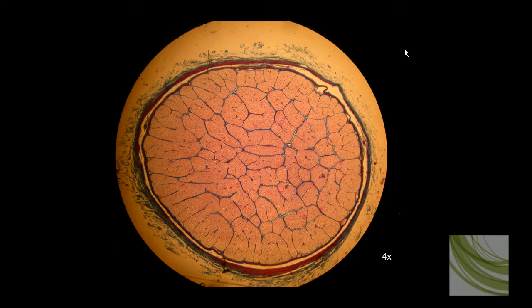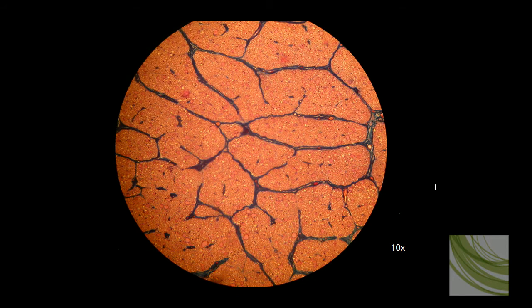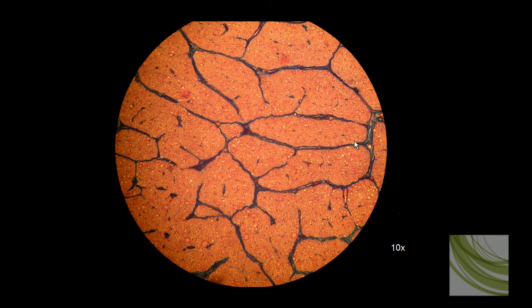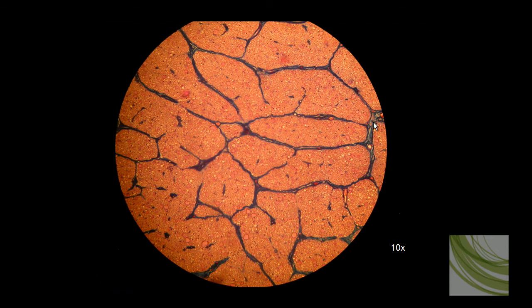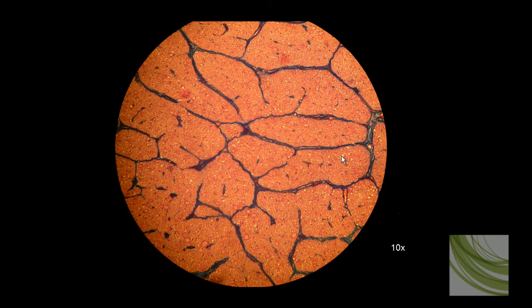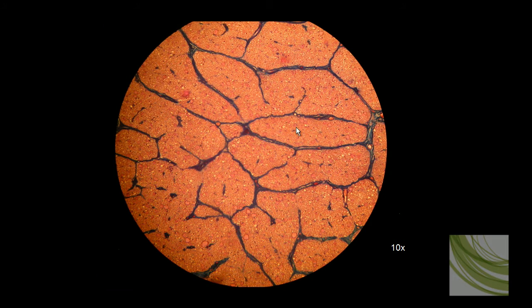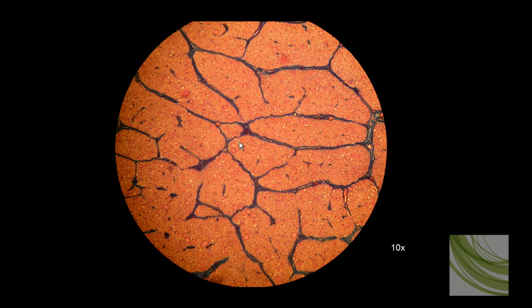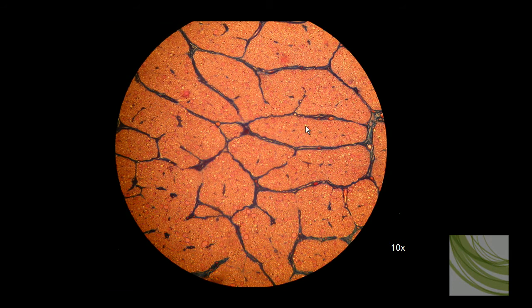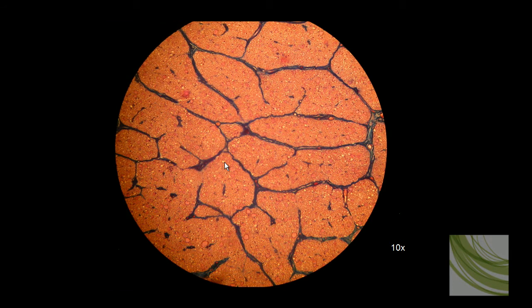Next we're going to bump our magnification up to the 10x objective. Here we're looking at the same slide using the 10x objective, and at this magnification we can see a lot more. We can see the perineurium, which arranges nerve fibers into fascicles. We can see lots of little capillaries and venules. These white dots represent nerve fibers and they're not stained — the reason being that fat doesn't stain well, so it often comes up as just a blank white spot.